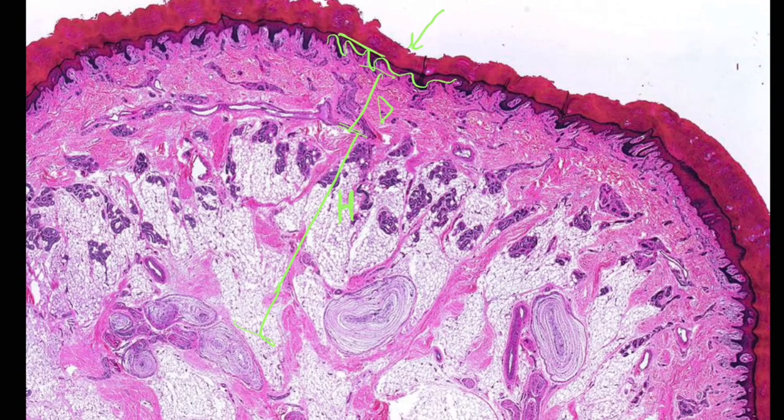So now that we've located our layers, we want to look within the hypodermis and the dermis for those Pacinian or lamellar corpuscles. And right away, we have a really nice example here. You can see it has these concentric layers or lamellae. It does look like a fingerprint. So that gives us a good clue that this is going to be that Pacinian corpuscle. We have another one here. And they won't always be perfectly round, but we have some really beautiful examples of it on this slide.